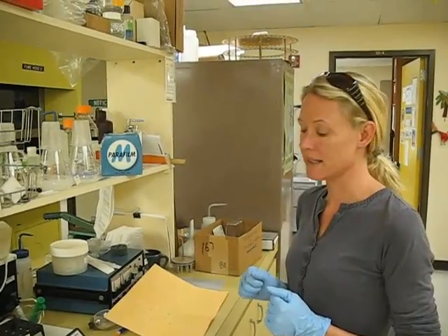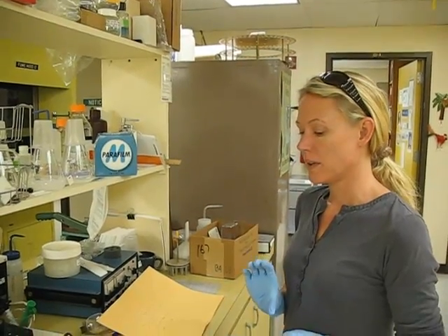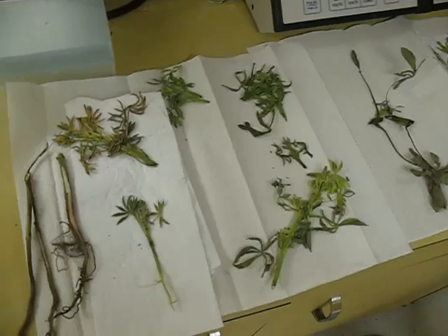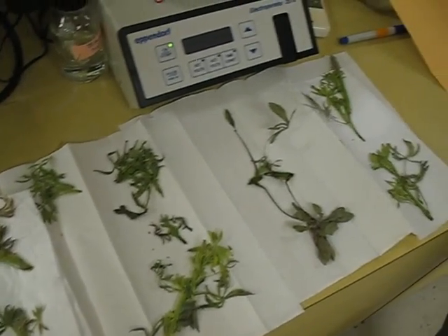They will go into a flask with about 20 mils of CTAB buffer — DNA extraction buffer — and they will go into water baths at 65 degrees for about an hour.